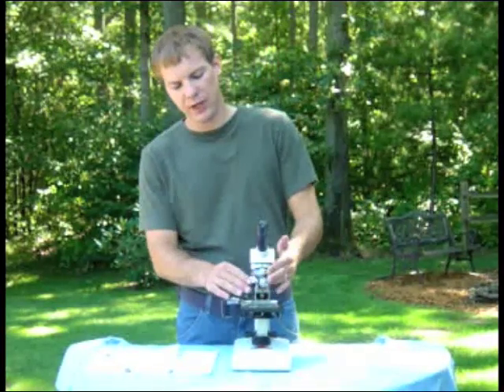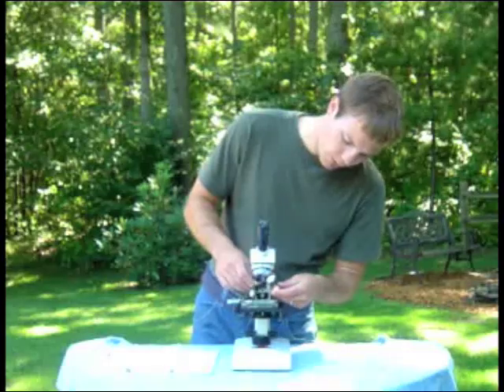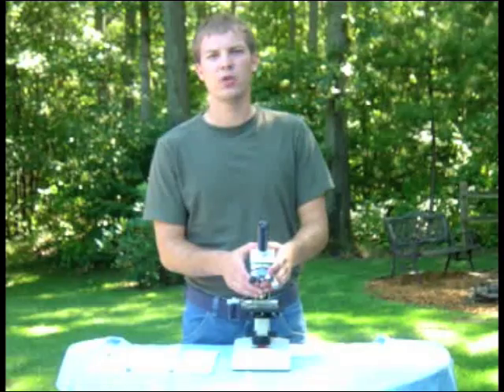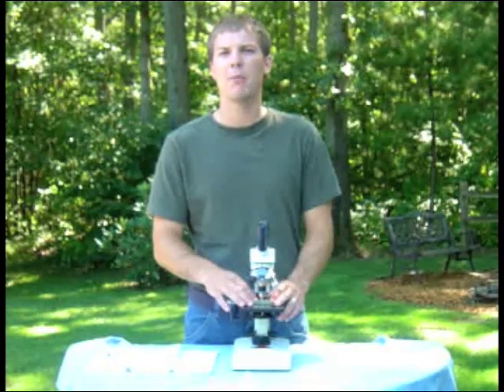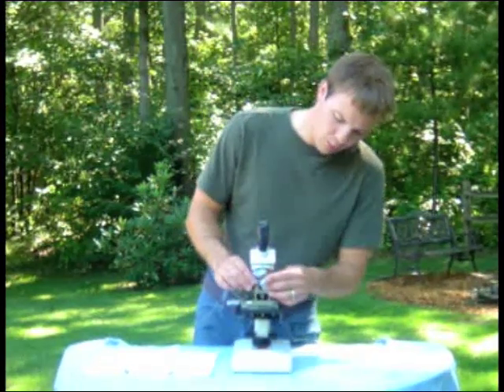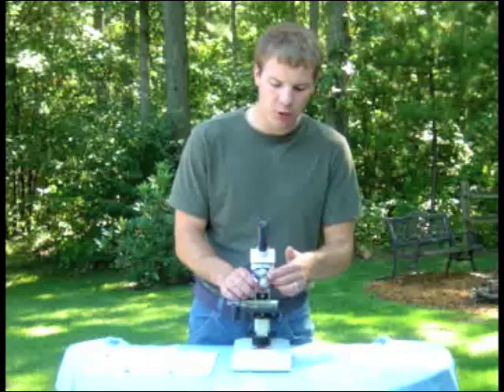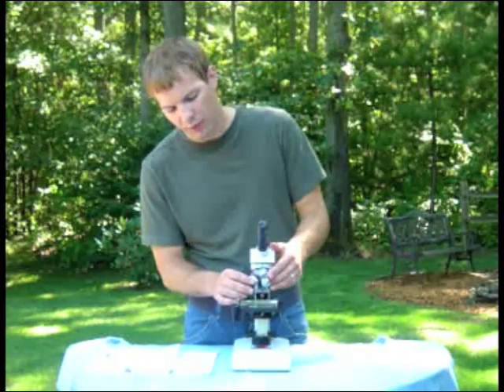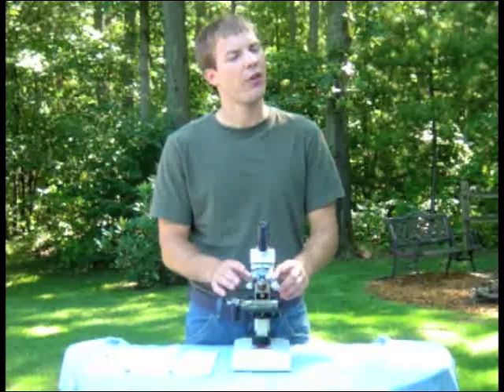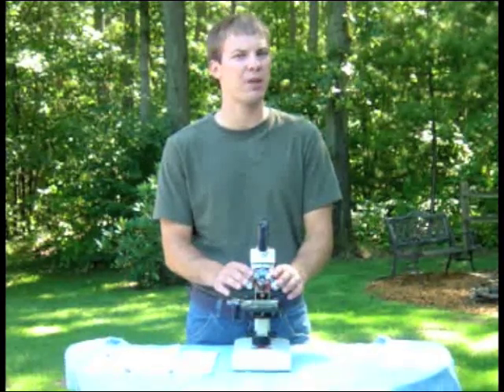First of all, we have three objective lenses here. The smallest one — the red one right here — is 4X magnification, so it enlarges whatever is under the slide by four times. The second one, yellow, is 10X. And the third, the high power, is 40X. So we have 4, 10, and 40. Now that is not the total magnification — that is only the magnification of the objective lens.